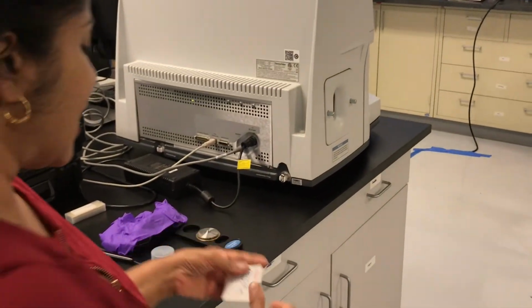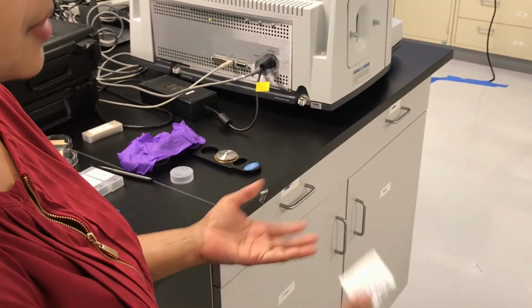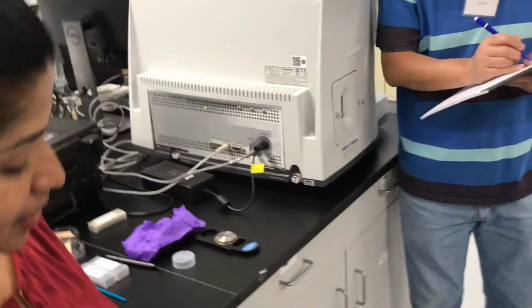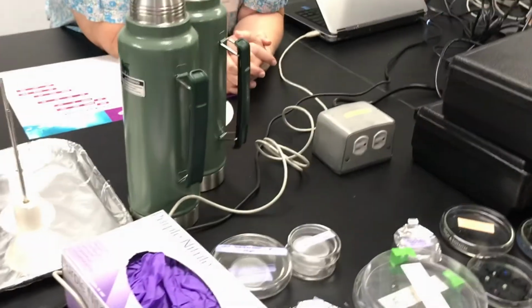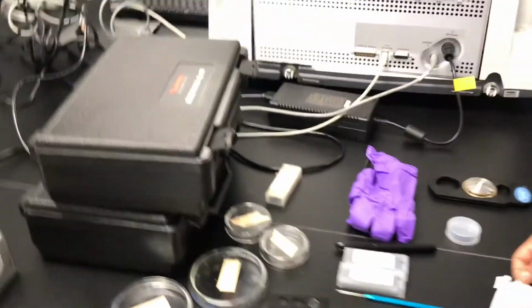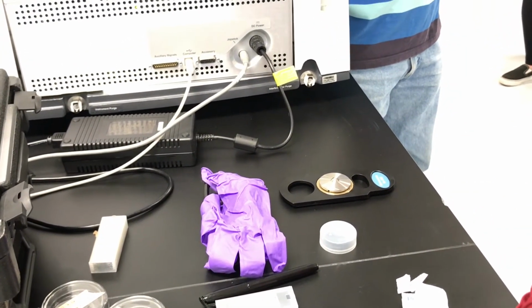And yes, before you start and after measurement, always you have to clean the ATR. Each measurement, you have to clean. And that's for both machines. For this and this, ATR as a technique in general, you have to clean. So just clean the tip of it. You usually are good. There are sticky things that may sometimes stick on it, so you may want to take it under a regular prep microscope.